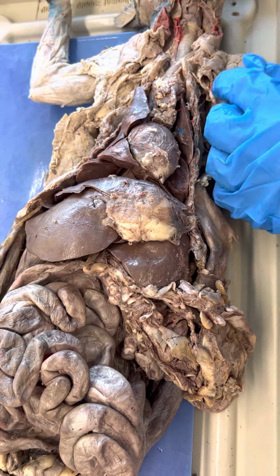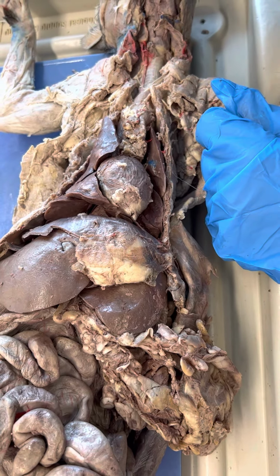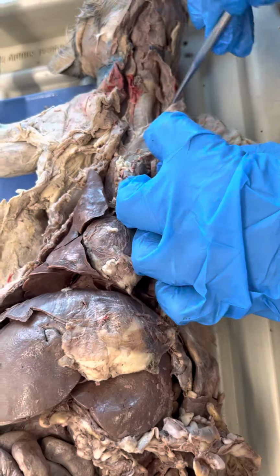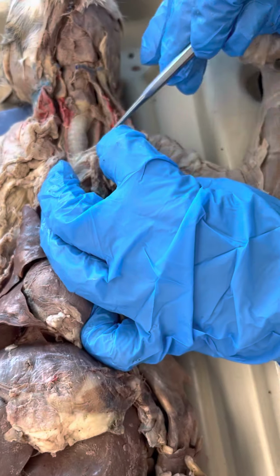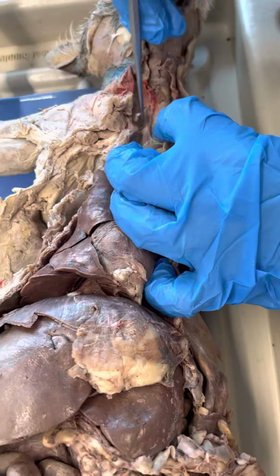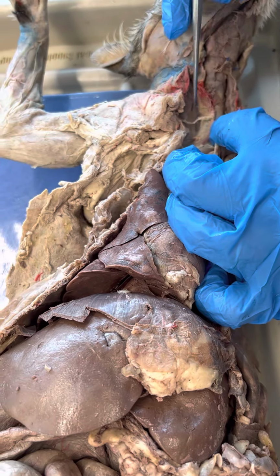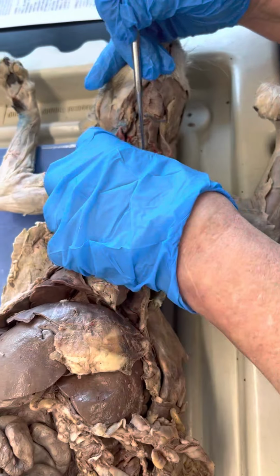Okay, trachea is right here. The trachea has the rings. The larynx is solid. Let's see what else we have here. I should be able to see the esophagus. Now I'd have to dissect this out a little more, but the esophagus is this structure. It's like a flat structure underneath. It sort of collapses. It's not well dissected on this cat, but it is underneath here. It would be underneath the trachea.